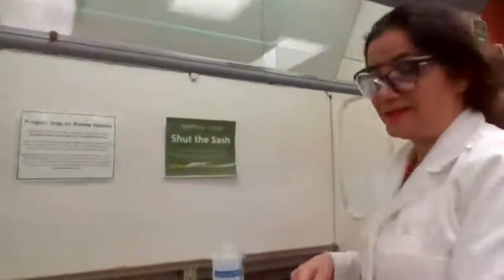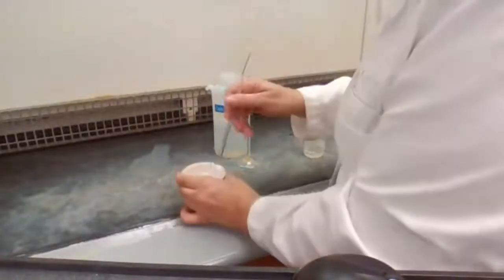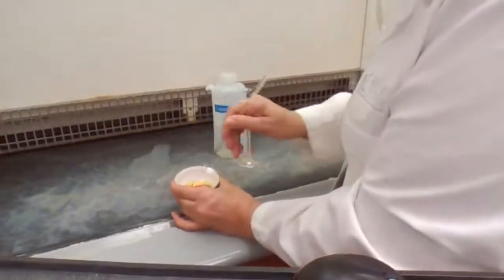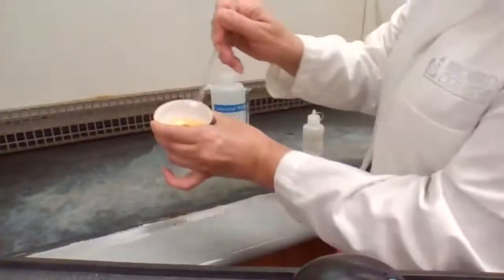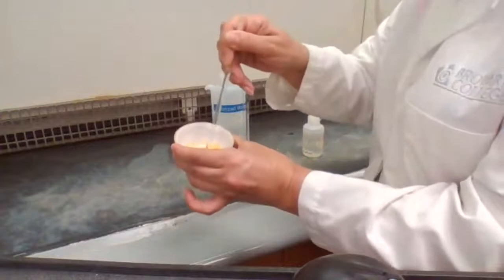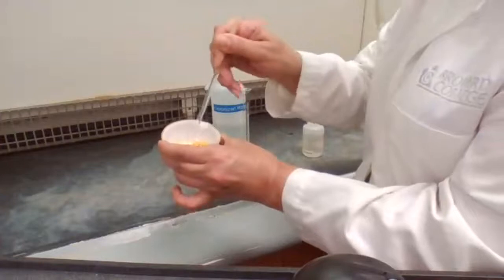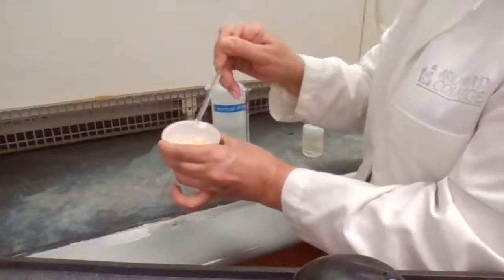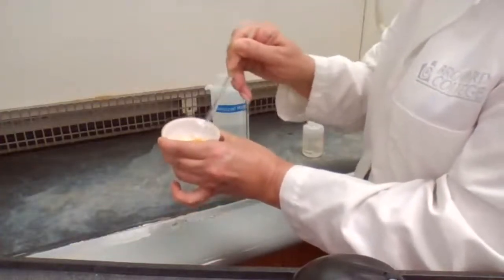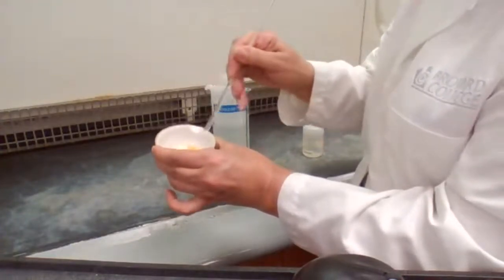I'm taking you back and forth because I'm working by myself. Usually when you are in the lab, you work in a group of 2 and you can share the work. But for me to do the experiment by myself, I want to make sure that you actually get to see every step. So you're not just working with data, you're actually watching the experiment, just as if your lab partner was doing this part of the experiment and you were recording data and doing another part. So you get a better experience with the remote lab.